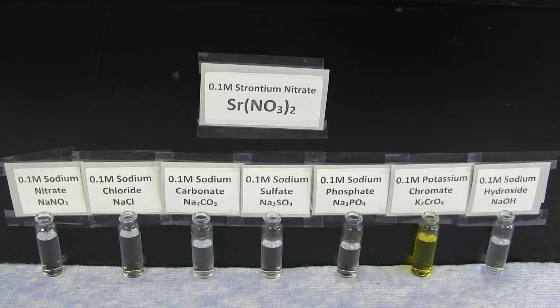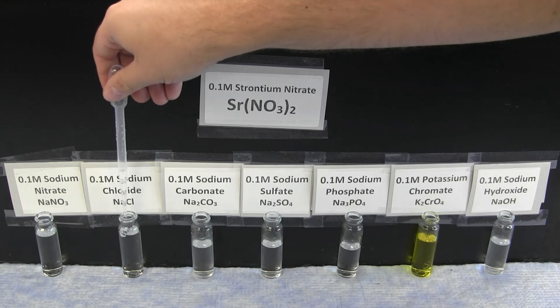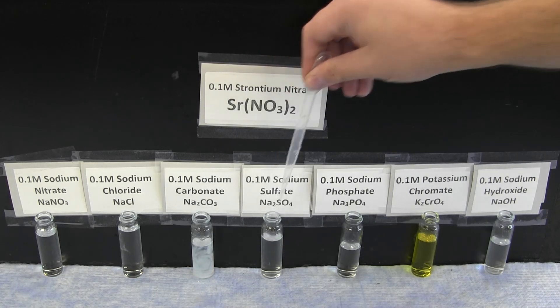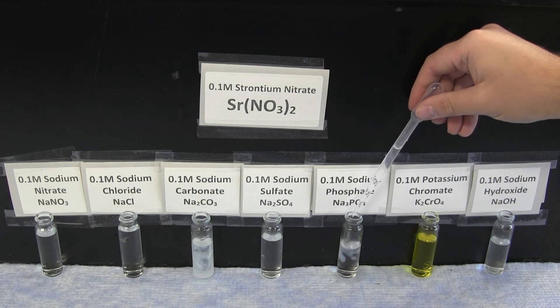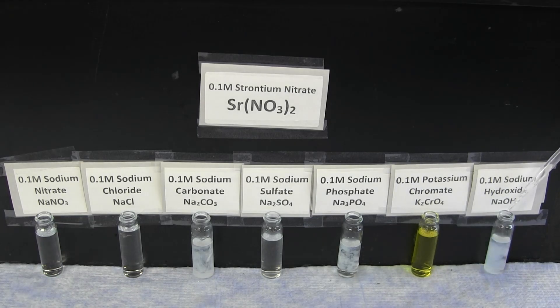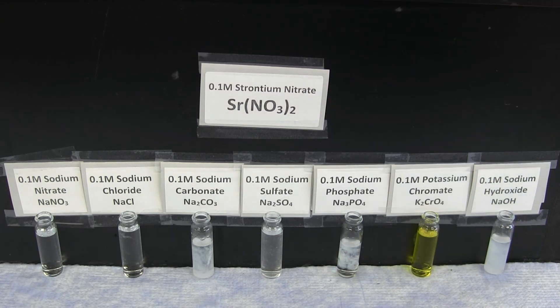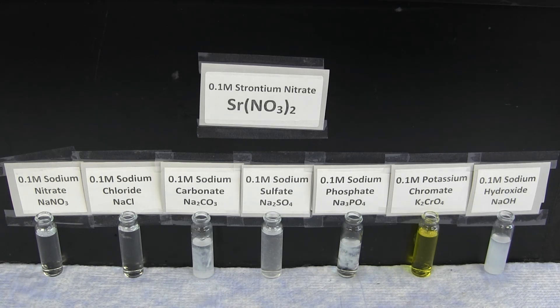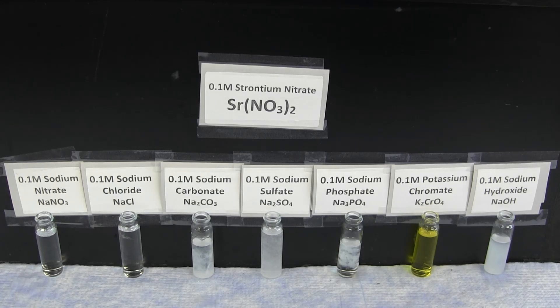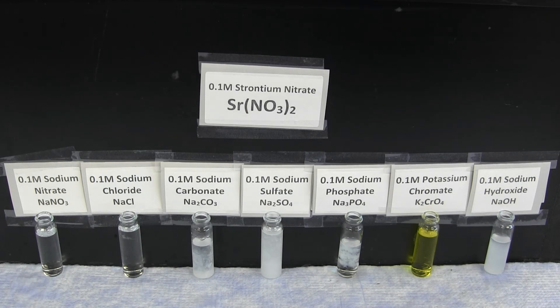The next ion to observe is the strontium ion. The strontium ion forms a white precipitate with sodium carbonate, sodium phosphate, and sodium hydroxide, and a slight precipitate with sodium sulfate. There is no reaction with sodium nitrate, sodium chloride, or potassium chromate.